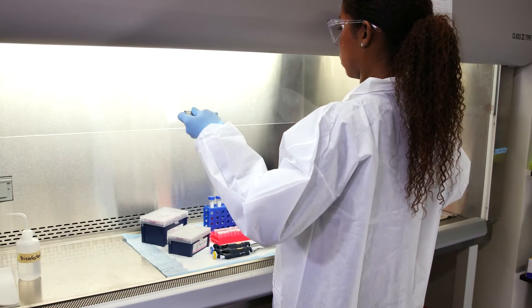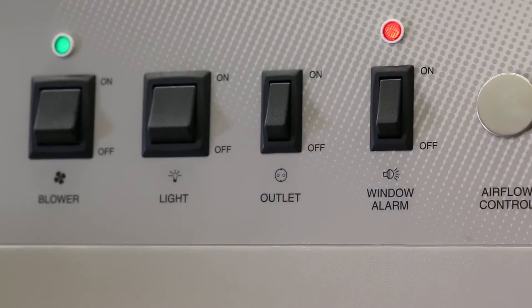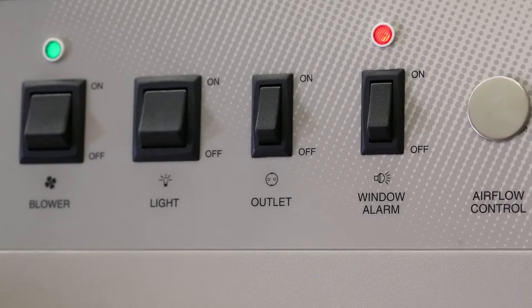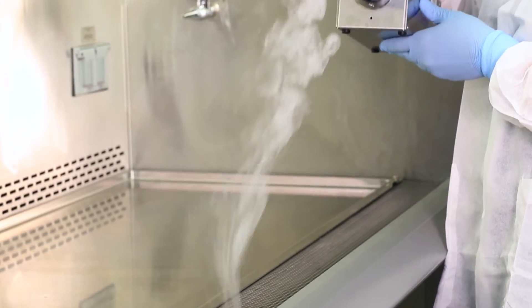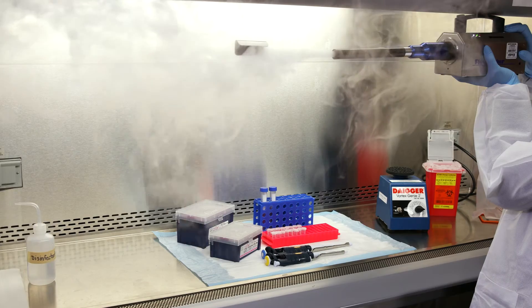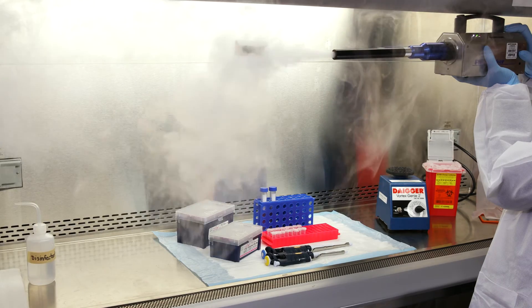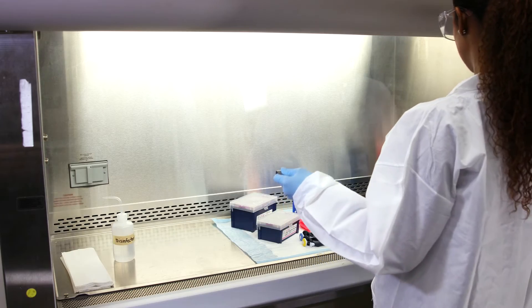If the sash is set too high, an alarm will sound. This indicates the inward air velocity may slow down to a point that it cannot provide and maintain containment at the sash opening. This could cause contaminated air to leak out of the cabinet or room air to enter the BSC opening, mix with the downflow air, and potentially contaminate the work product.